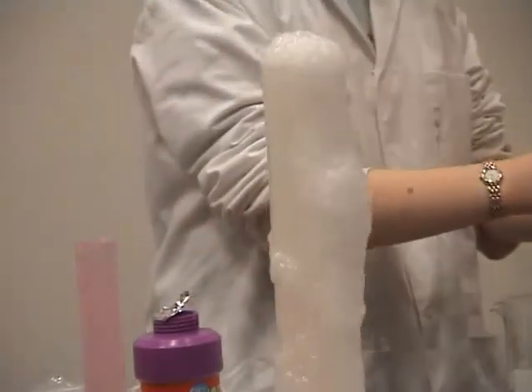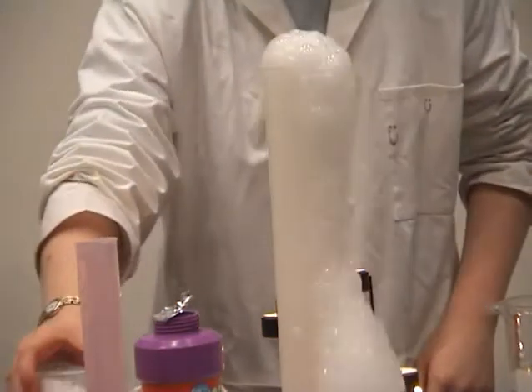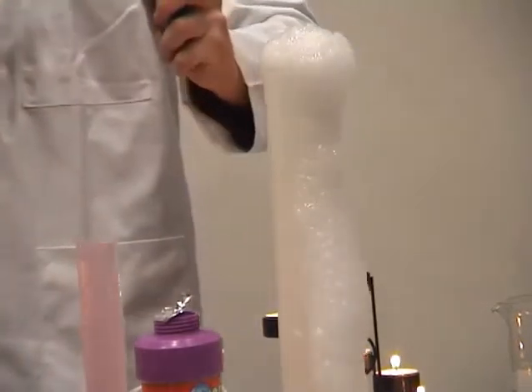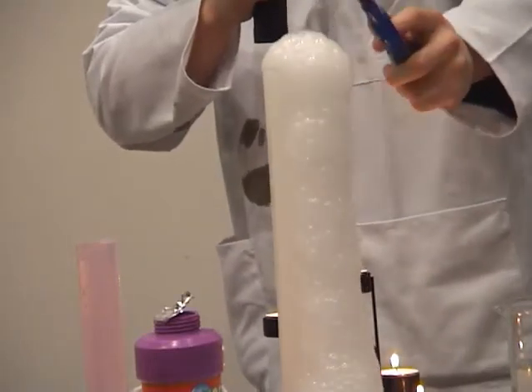It'll blow up? Who says it'll blow up? Put up your hands if you think it'll blow up. We have one very brave girl down the back there who thinks it'll blow up. Oh God, sorry. Right, well, we'll put the flame down there to see.